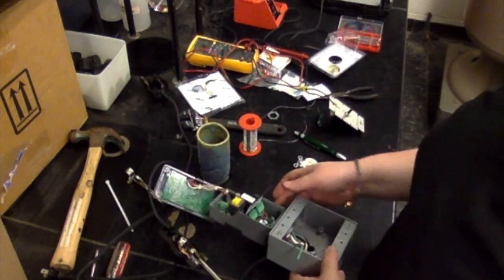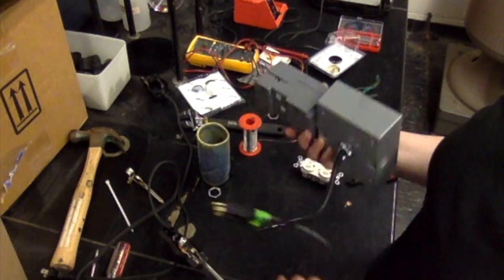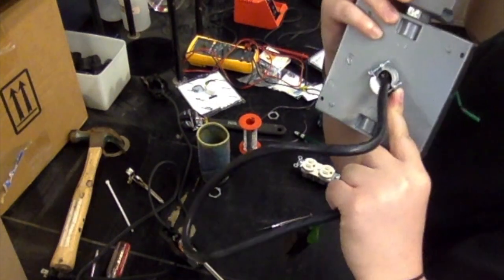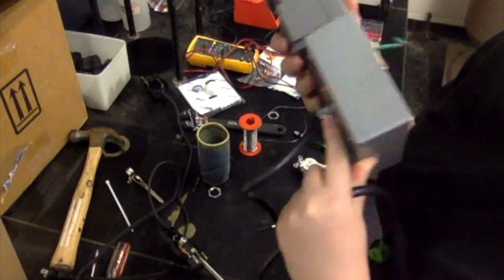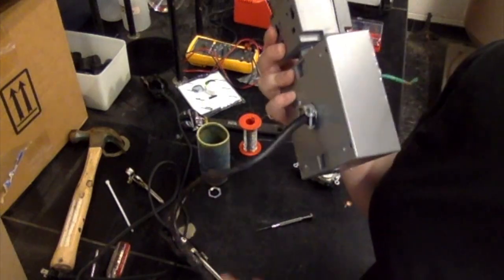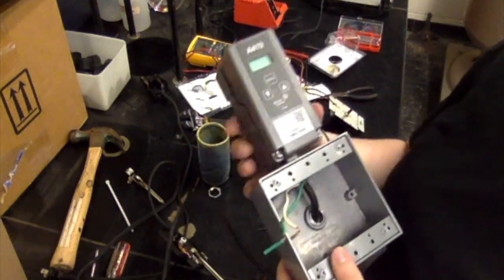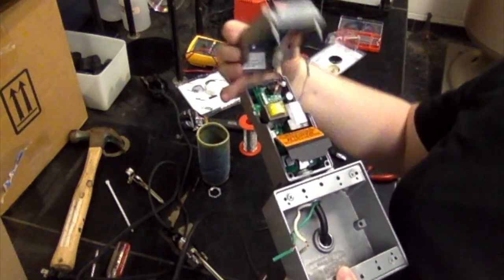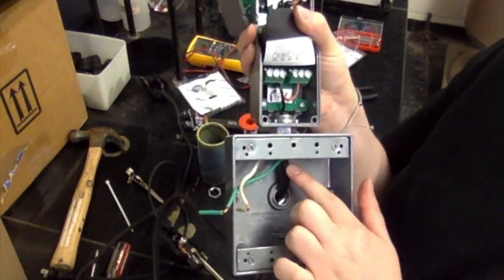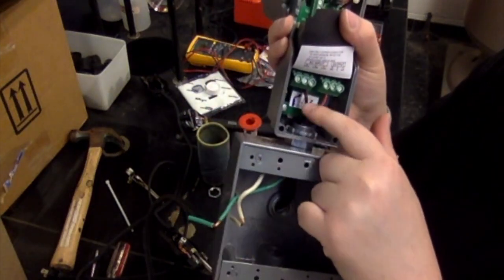The first connection that we're going to make is the line cord to the A419. To do that, you're just going to feed the line cord in through the back through a 3/8 inch clamp. I wouldn't tighten that clamp down until we're finished with the wiring, just so that you have more wiggle room when making these connections. There should be 3 wires with the line cord. We have a black one, a white one, and a green one. What you're going to do is feed the black one up into the A419 and connect it to port number 3.